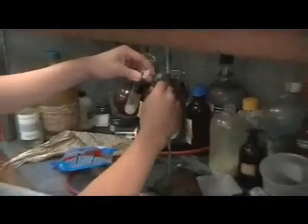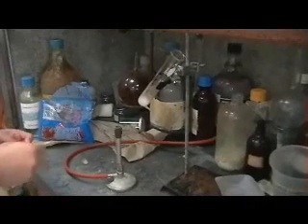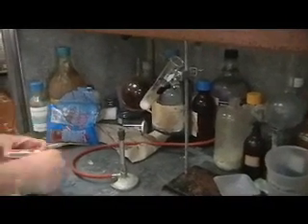It has to be completely melted. And then put it in. Should the flame be angled to the right? Be sure to take any precautions with the Bunsen burner and the decomposition of the potassium chlorate.